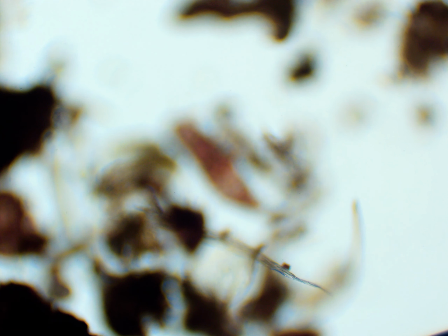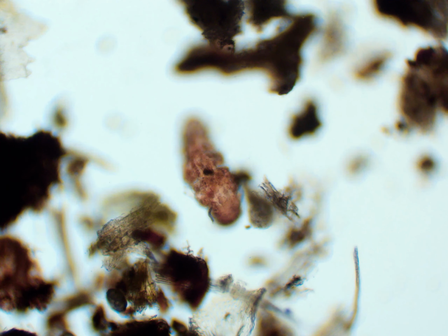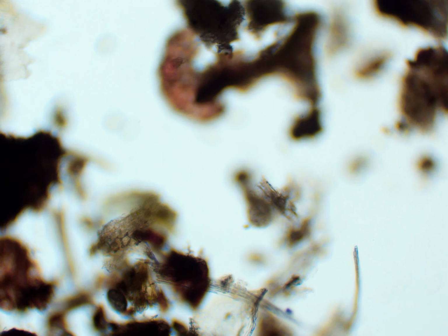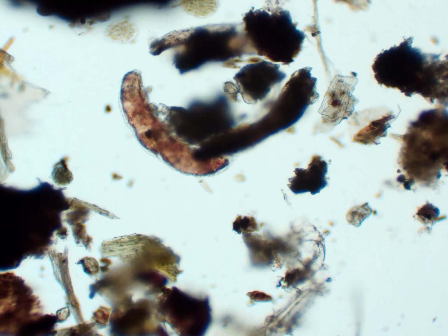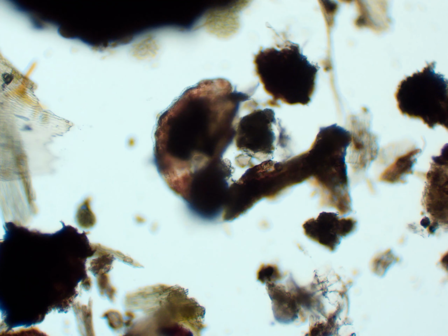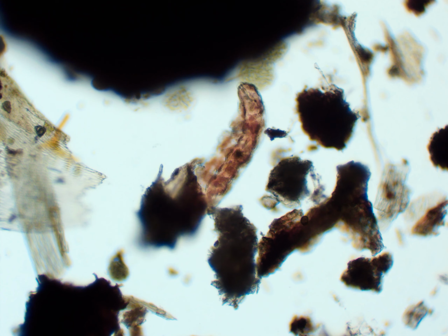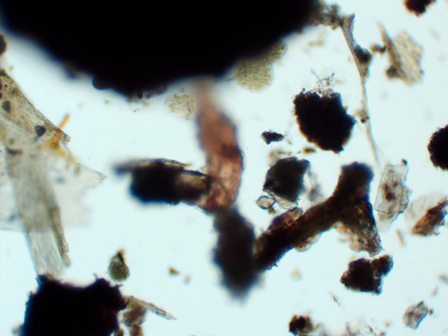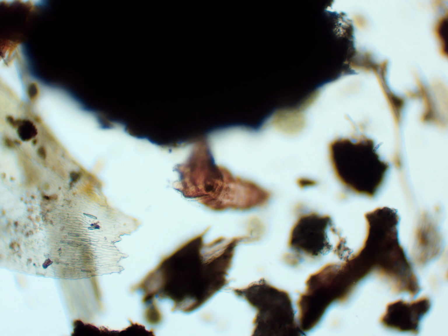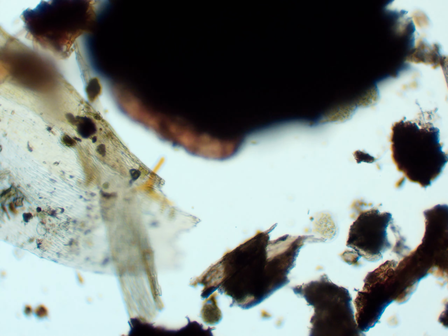I'm having a little bit of an issue with Adobe, so what I am seeing might not be exactly what you're seeing because of the transitions and how they're displayed, but you can see it wedging itself around this dirt and sediment, and a lot of this is natural biomass from the moss and the moss's roots. You can see all of its 8 little legs right now, and the 2 oddly shaped legs at the end of it controlling its back.